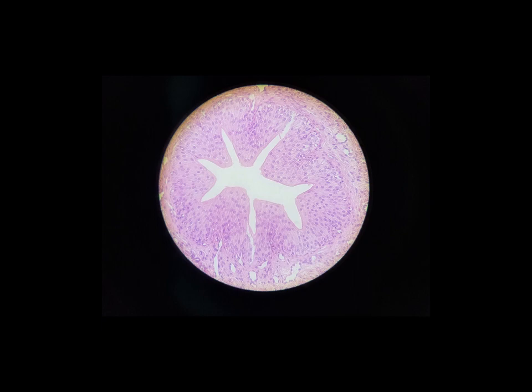This is the last of the epithelial tissues we'll look at. There are other types of epithelial tissue in the body besides the ones we've looked at. We're just looking at those that are the most common. So this last type, it is a stratified epithelium, but it doesn't have that in the name. This is called transitional epithelium. And if we look at these cells here, some of them are columnar, some of them are cuboidal.